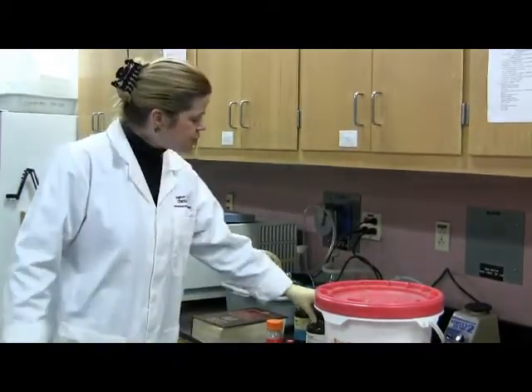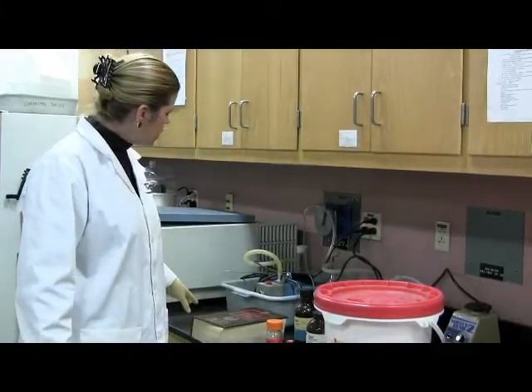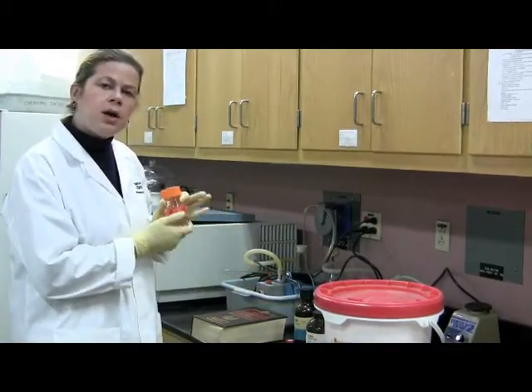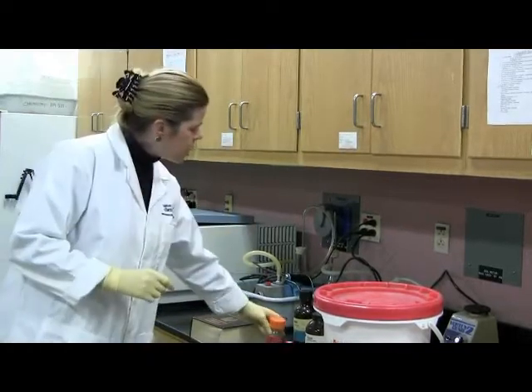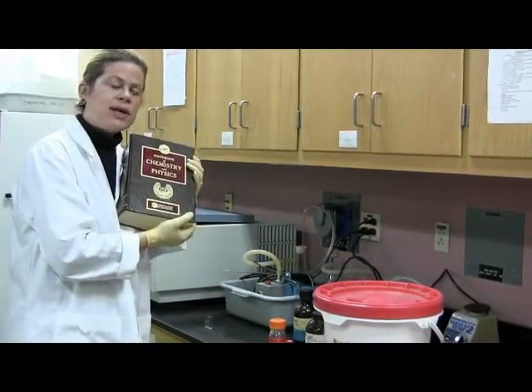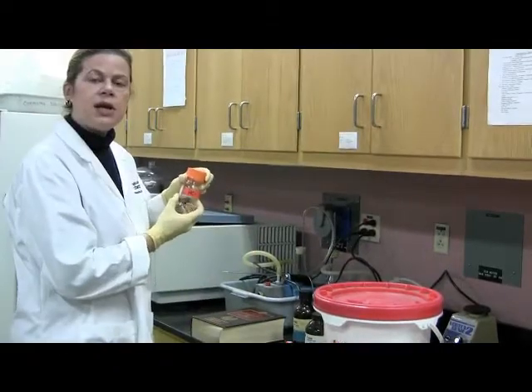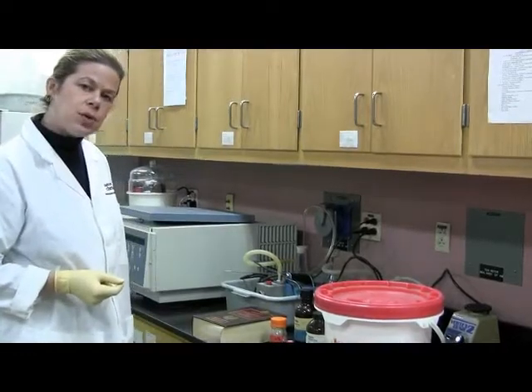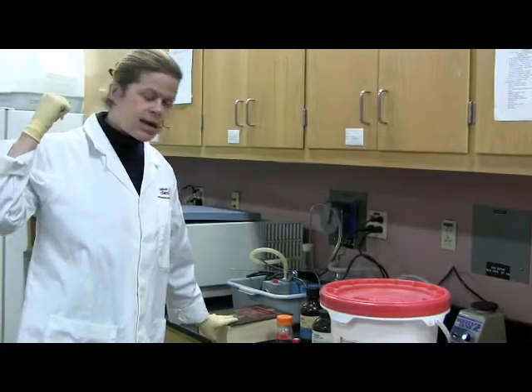So you're going to weigh out the trypsin, and you're going to weigh it out into 0.001 normal HCl. And how are we going to do that? We are going to use the Handbook of Chemistry and Physics and find out what is the concentration in molarity of 37% HCl. And we're going to find that out, and we're going to use that information to prepare 0.001 normal HCl. This is available in the book cabinet over to the side of the lab.